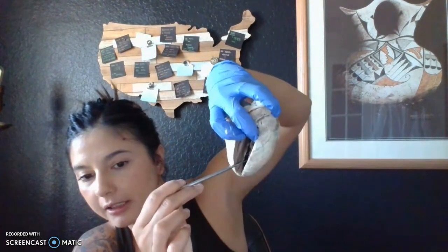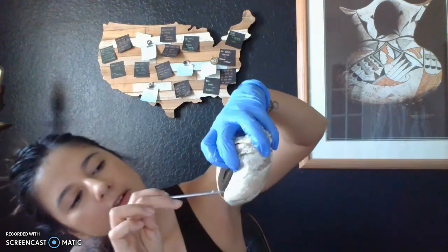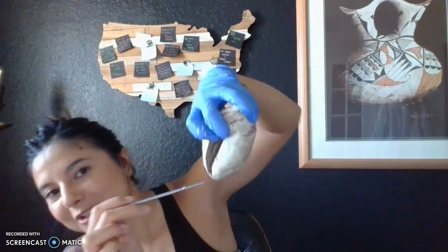The interventricular septum, I did cut into a little bit so that I can have the ability to part it better and to view the different parts of the heart, not just according to this list for this presentation, but also on the lab instructions. So hopefully that's okay. It's basically there in the middle, separating the two ventricles.